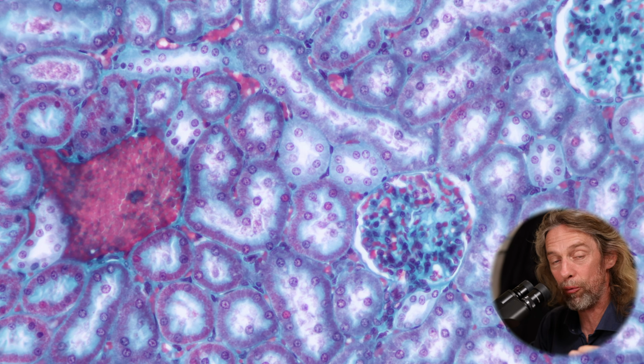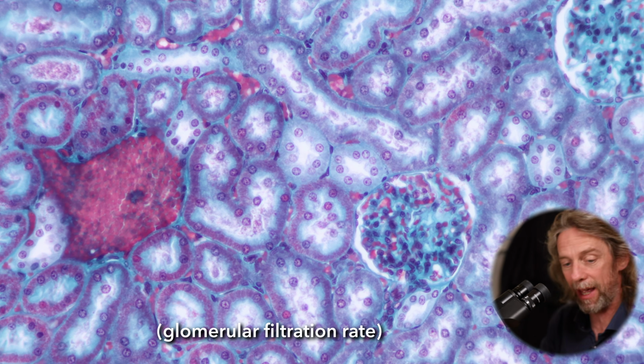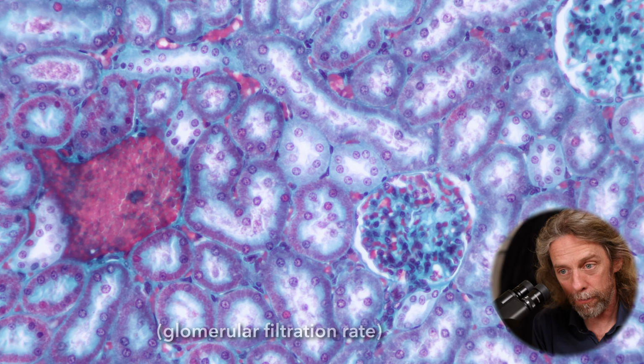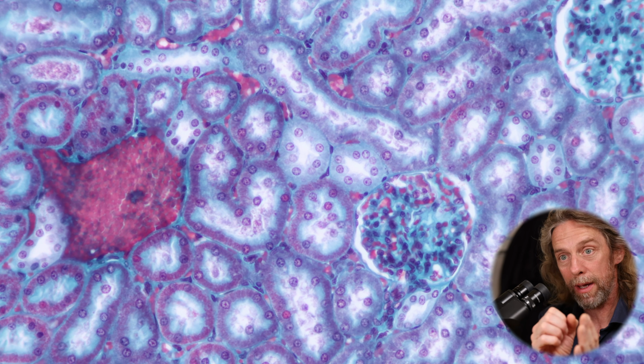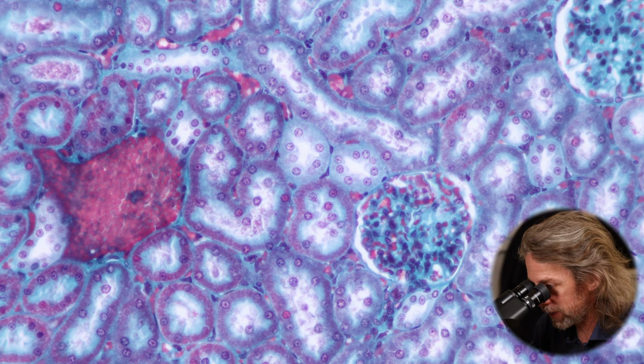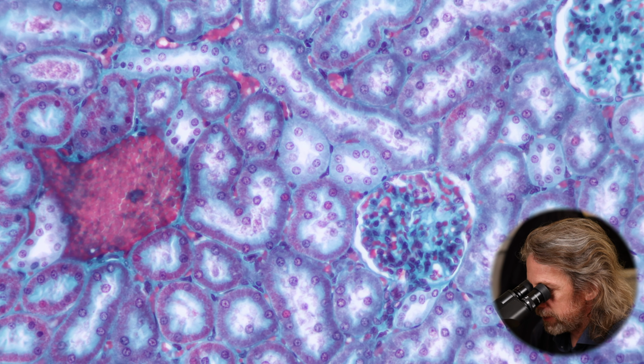And that's how the kidney regulates its own filtration rate. It will also regulate systemic blood pressure. So there's an interaction there. The cells are making an interaction based upon the fluid that's passing through the distal tube and then the activity of the renal corpuscle. Oh wow, it's all so confusing.